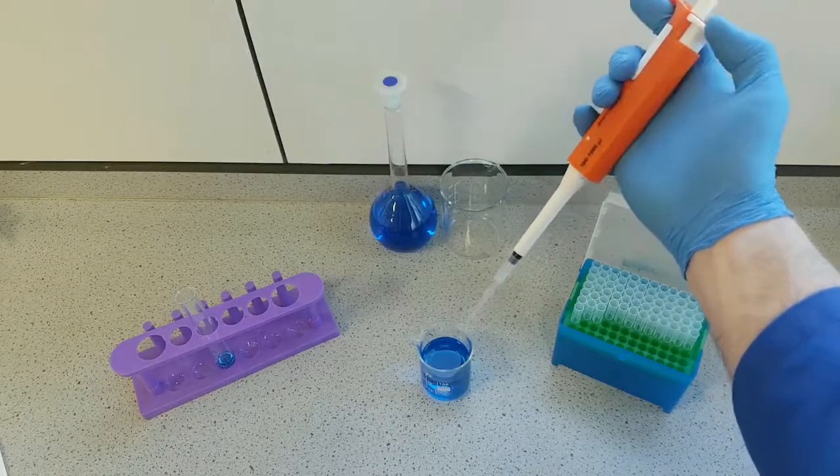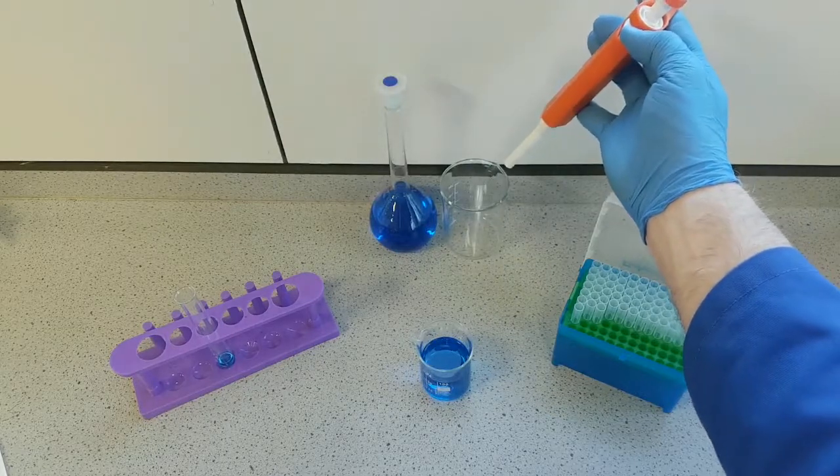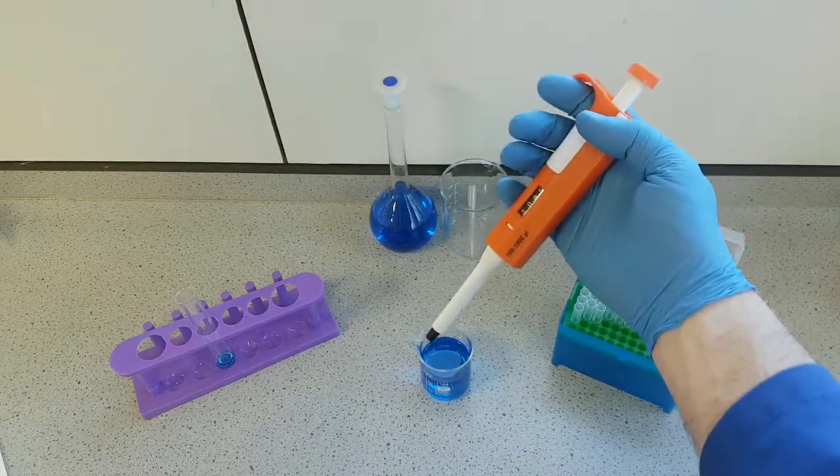Job done. To remove our pipette tip, we simply press the eject button into a waste or sharps bin.